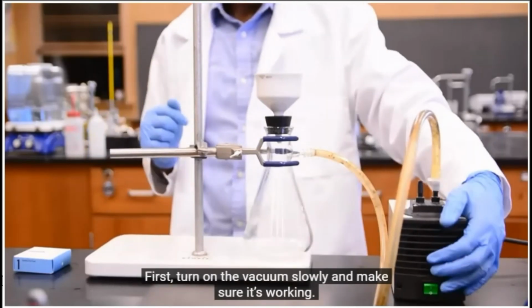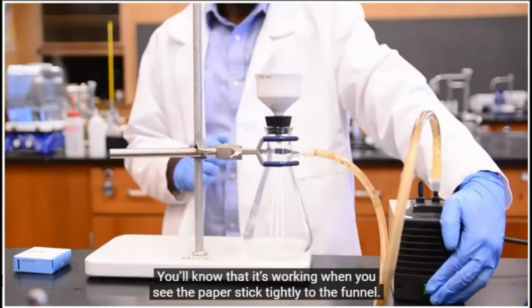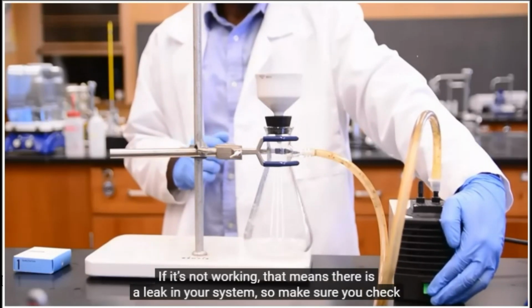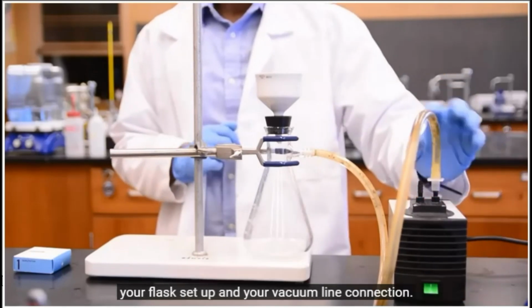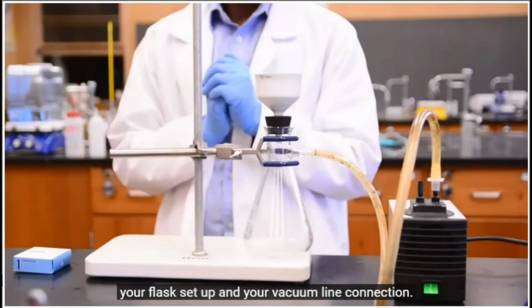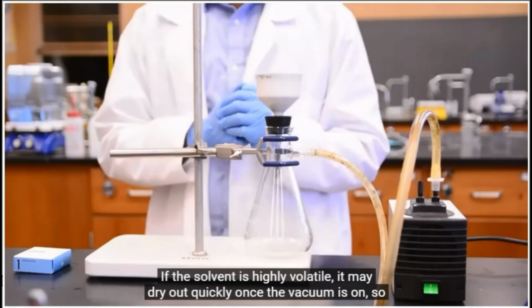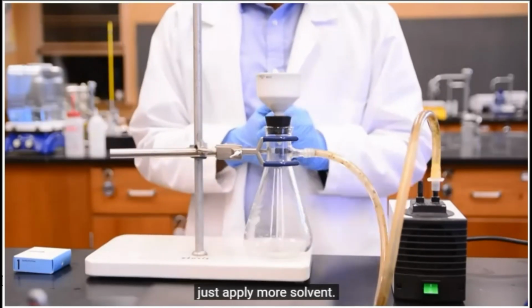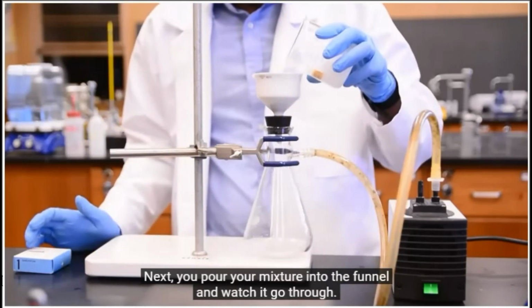First, turn on the vacuum slowly and make sure it's working. You'll know that it's working when you see the paper stick tightly to the funnel. If it's not working, that means there is a leak in your system, so make sure you check your flask setup and your vacuum line connection. If the solvent is highly volatile, it may dry out quickly once the vacuum is on, so just apply more solvent. Next, you pour your mixture into the funnel and watch it go through.